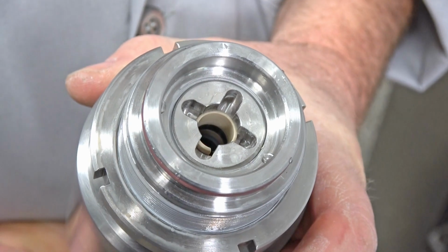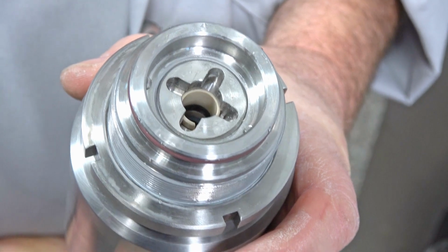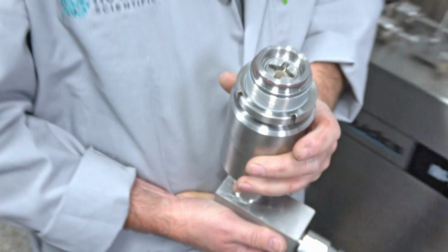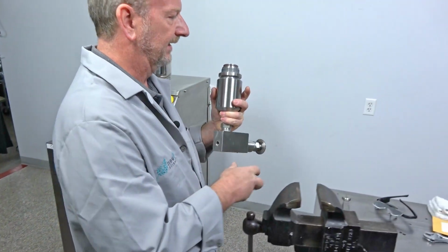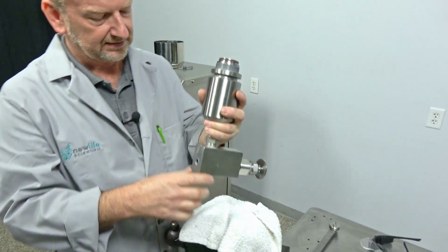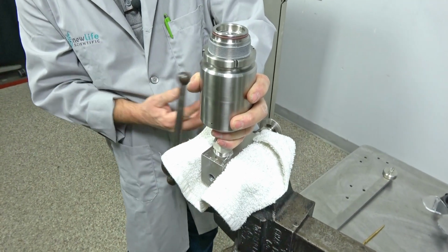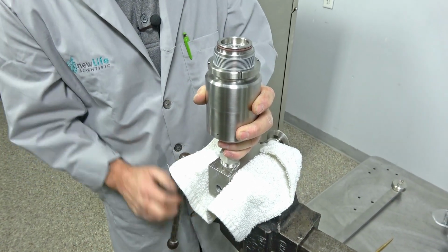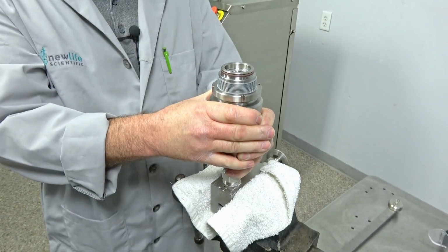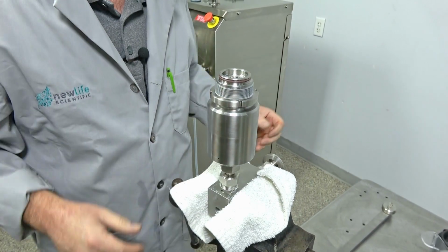And you're going to see some other seals and different things here that we're not going to change. Like I said, they last a lot longer than the plunger seal. So I've got my vise set up here, and a rag set up here too, because I don't want to scratch this when I clamp it in. I'm just going to clamp it right there. And that gives me a good solid work spot where I can get the next part off.